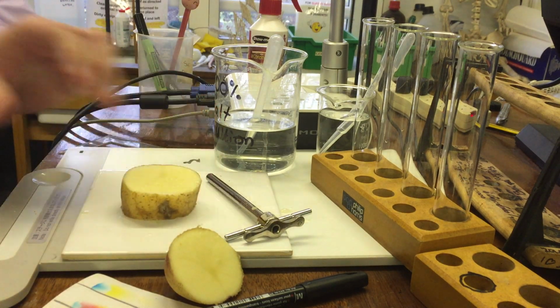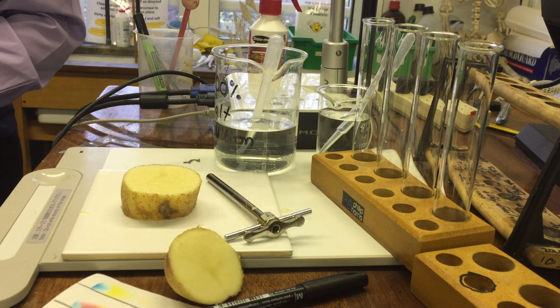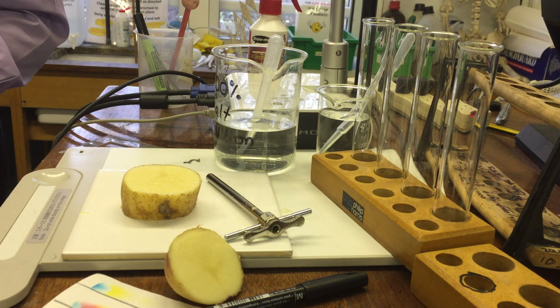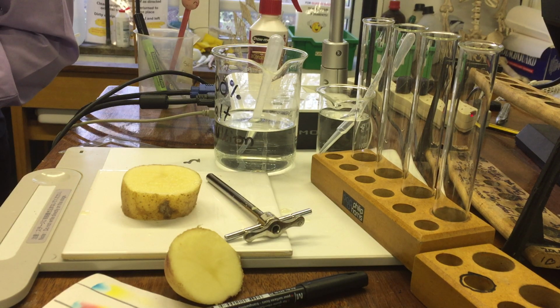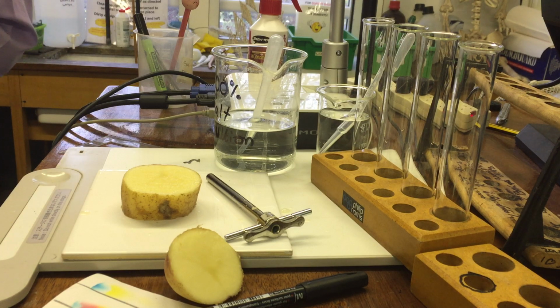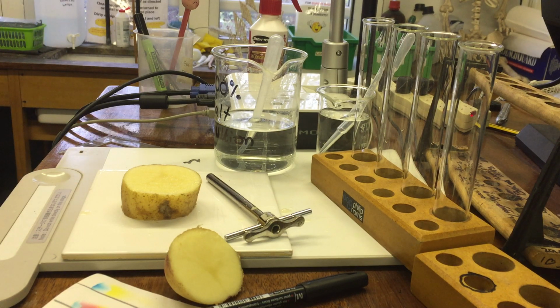So take your potato. Now, as you can see from the table we've got on the board, we've got different things we're measuring. So what's going to be the independent variable in this experiment? Like the amount of salt solution. I was trying to use the word amount. Okay, the concentration. Good, because amount can mean volume or concentration. So we're using the concentration of salt solution, of sodium chloride solution.